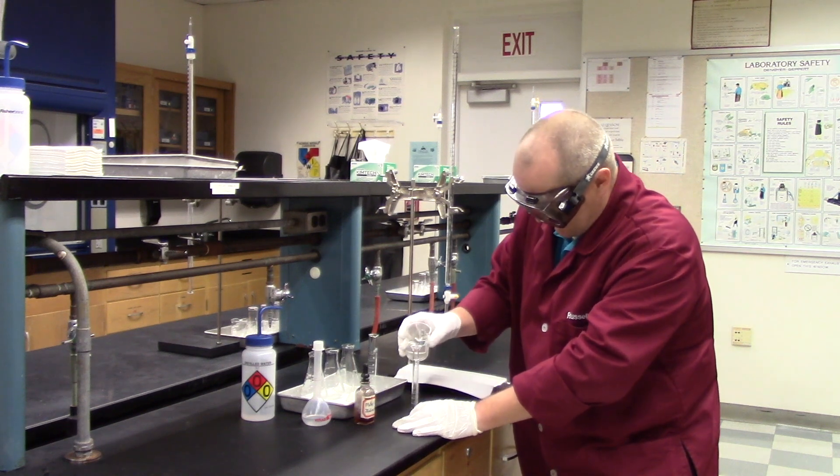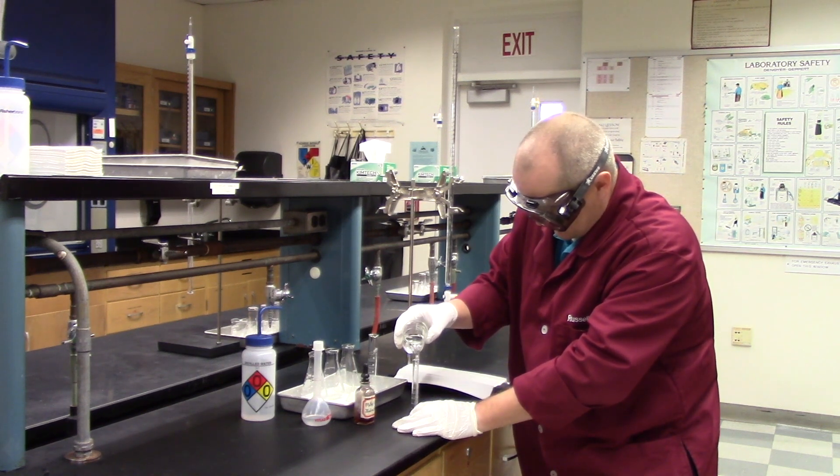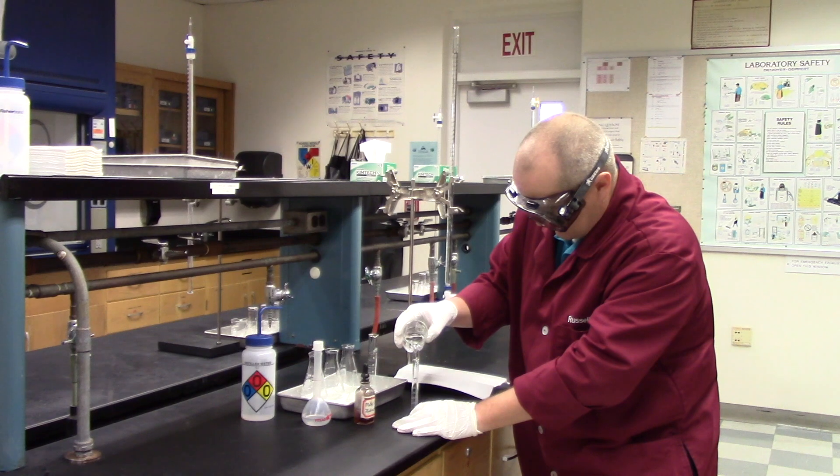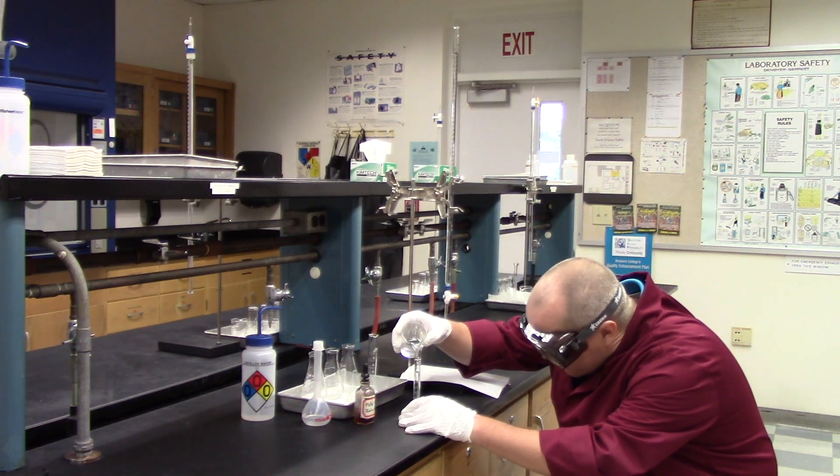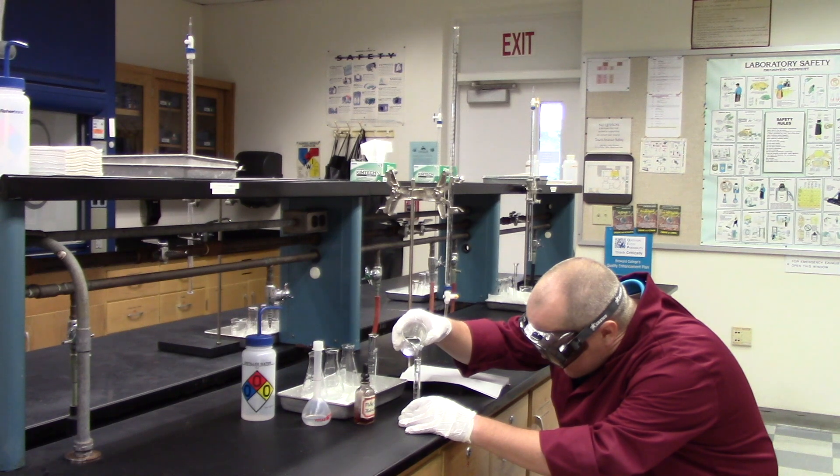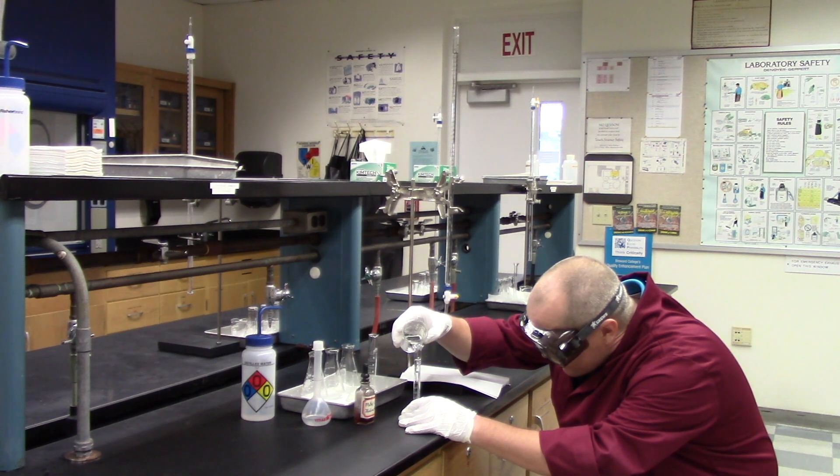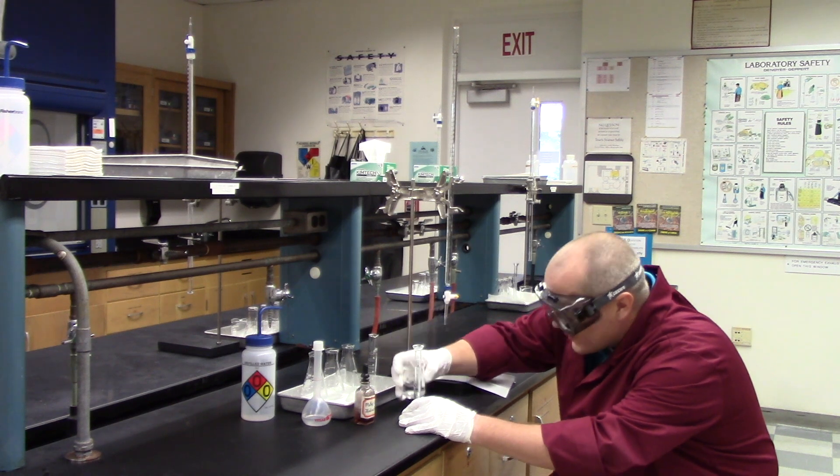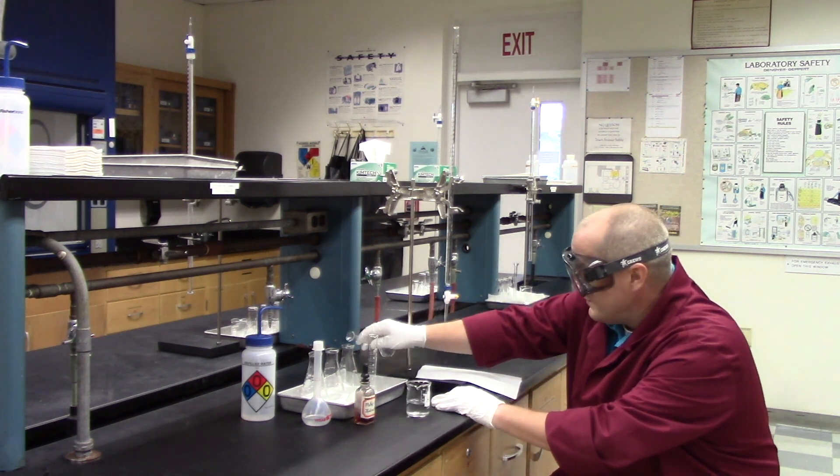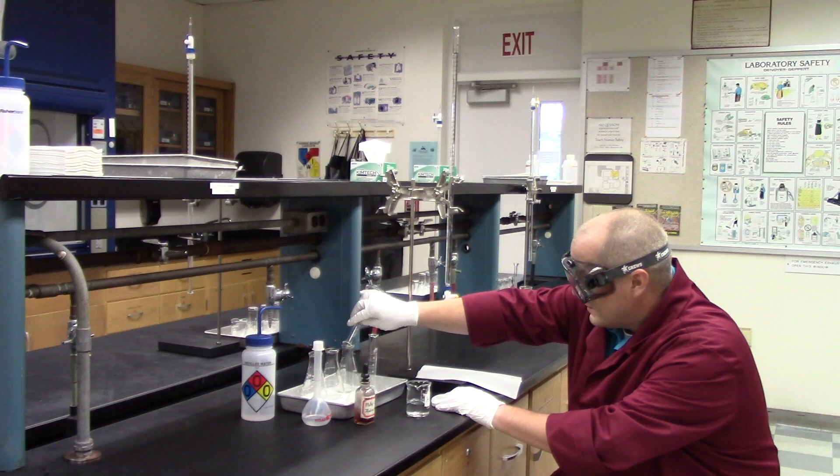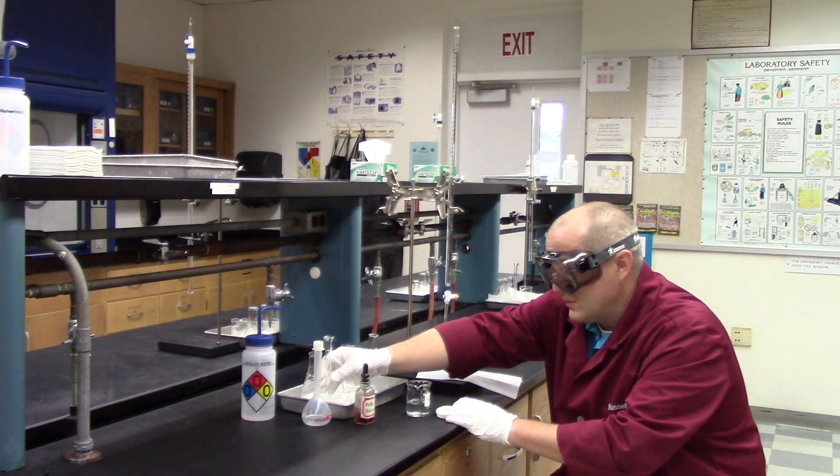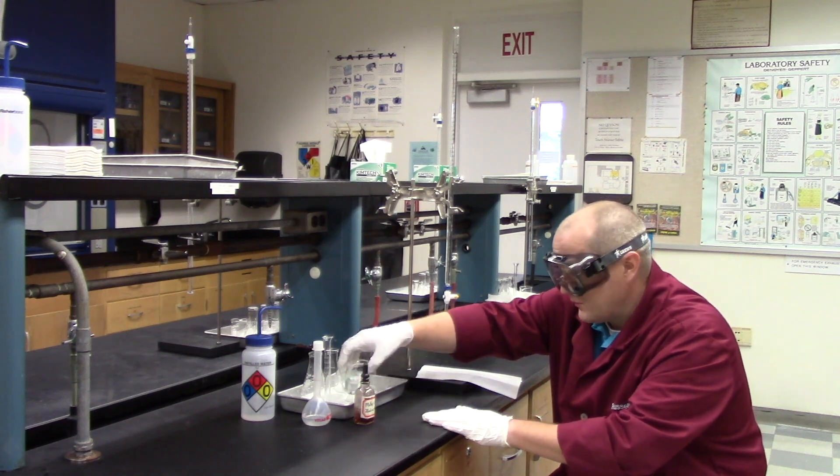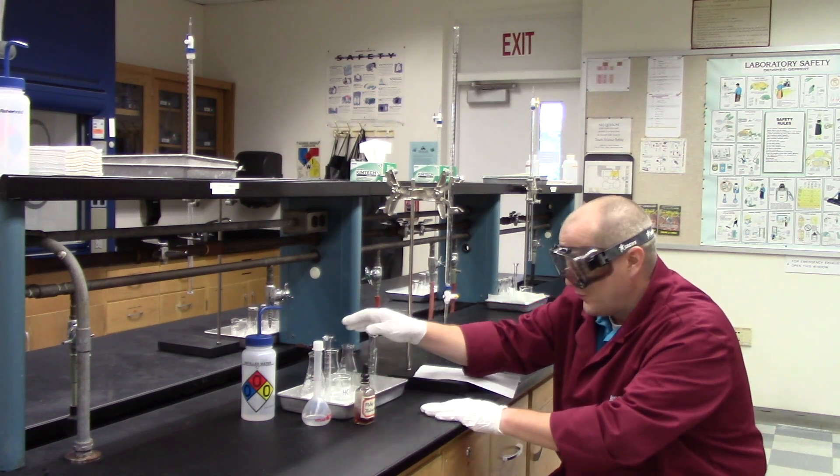You want to make three different solutions. Let me get down to the level of the thing here. There we go, 10 milliliters in one. And in the lab, you would repeat that for all three. For the sake of time in today's video, I'm not going to repeat it. I'm just going to do it for the one, but you would do it for all three.